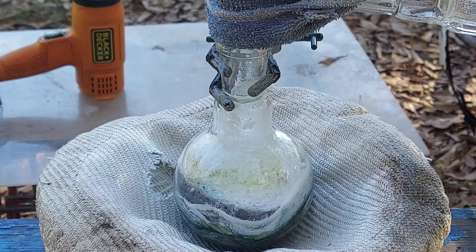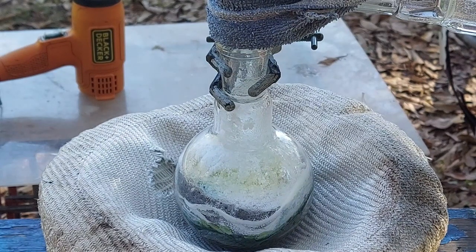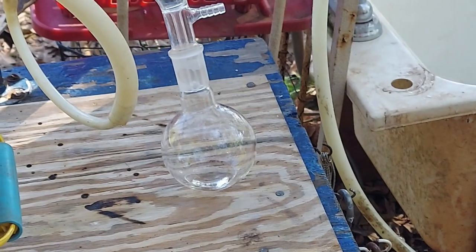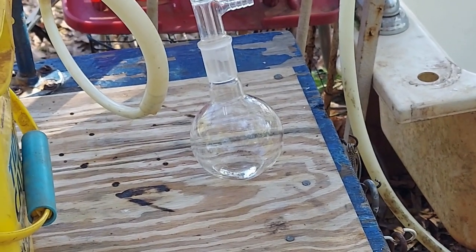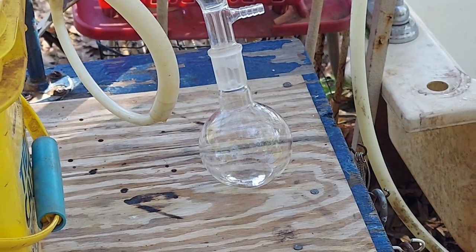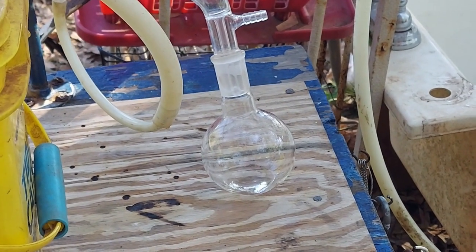I really should turn that temperature down a little bit. I got distracted filming this, but I'm just so excited — my copper chromite catalyst does work! That vindicates that prep and I still got it. Pyridine is coming through, and this is another thing I really needed too. I've got barely 10 milliliters of pyridine left, so it's not like I didn't need this.